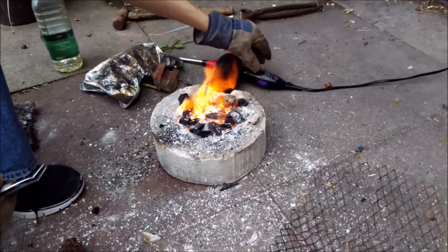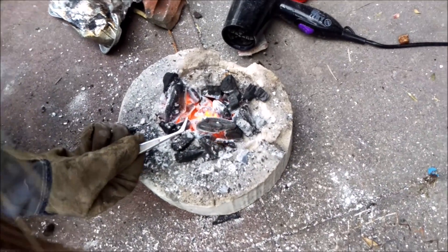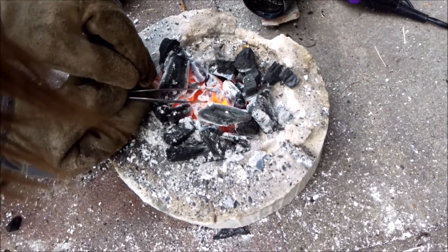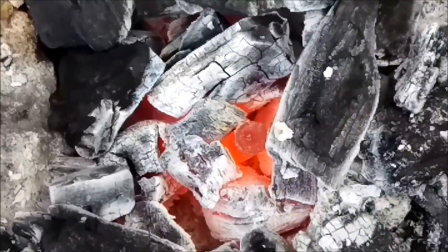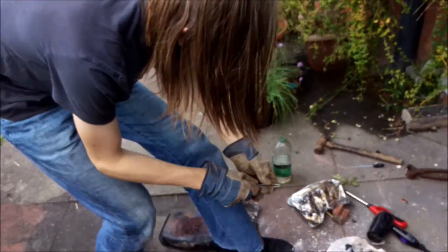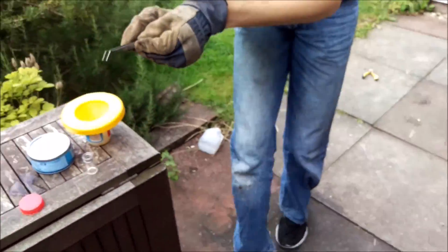I've got a tiny bit of gold and the forge is very, very hot. I need to very, very carefully — I'll switch the power off because I just need to very carefully get this into the crucible. Let the water boil off because it has been stored in water. Very carefully put it into the top of the crucible. It's there. It's solidified — we can do it off residual heat because it's so small. That's really useful because it means we don't have to deal with air.